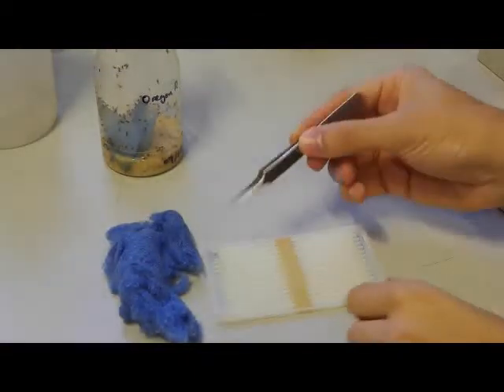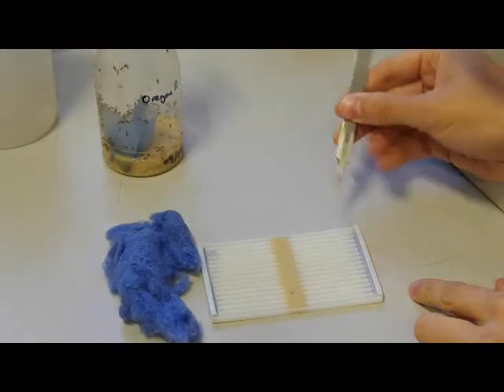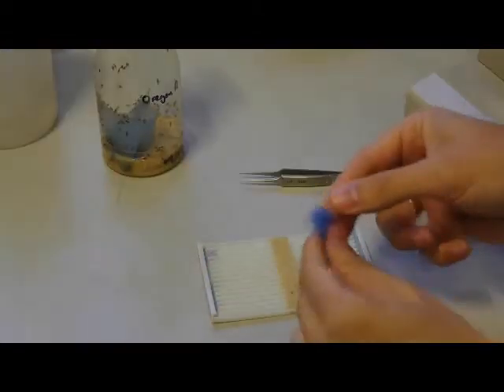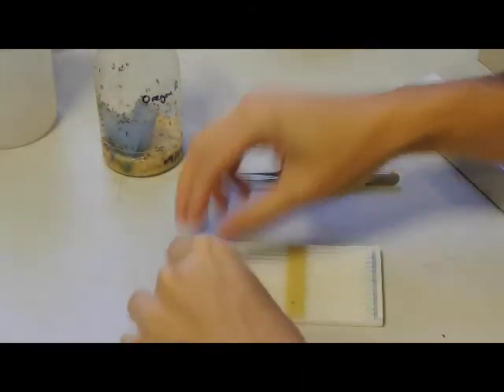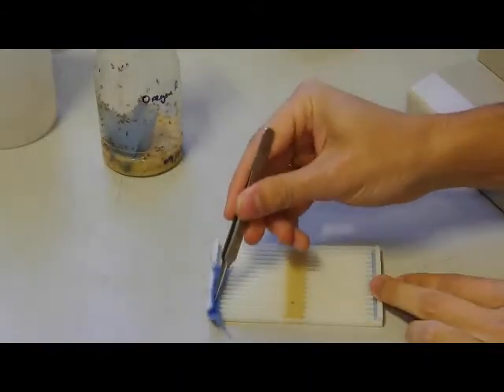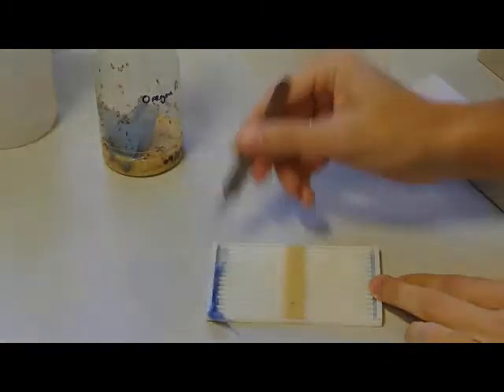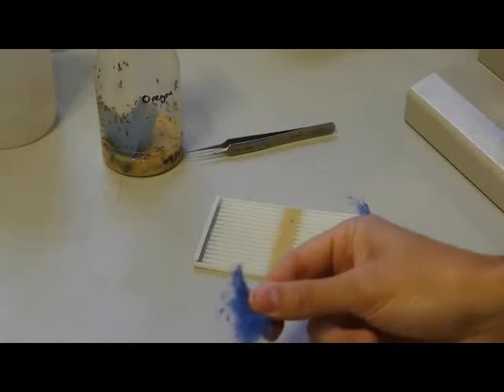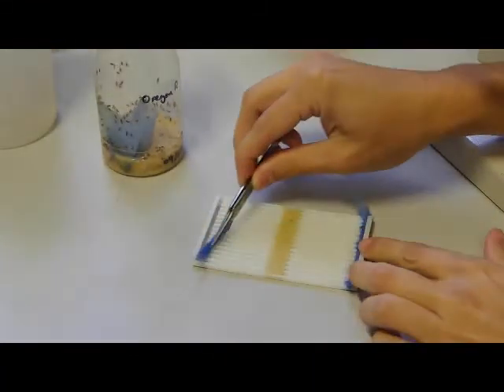Before placing the flies in, we will have to fit the extremities with something cozy. You can use yarn for this purpose, and it's actually going to be even easier to do. But for this demonstration, we will use colored cotton wool. Take little fragments of wool and shape them using your fingers so that they will fit inside the extremities. Use some forceps to push them well in. Do both sides this way.